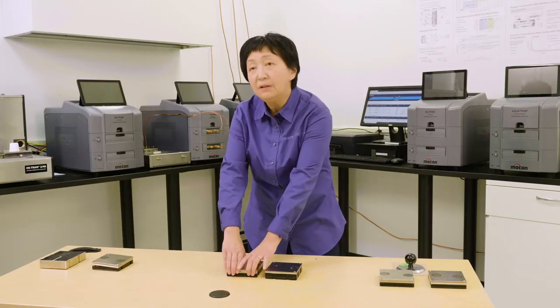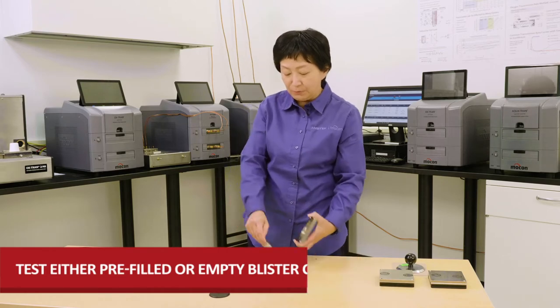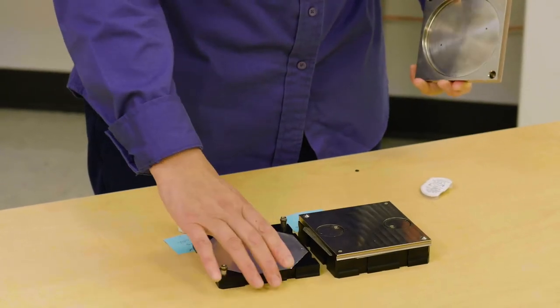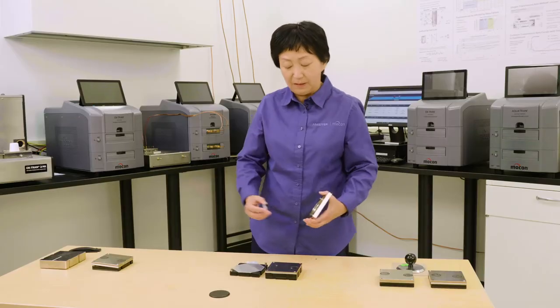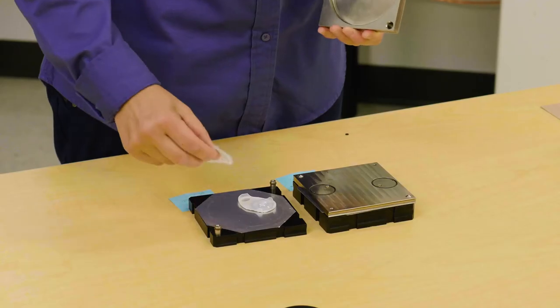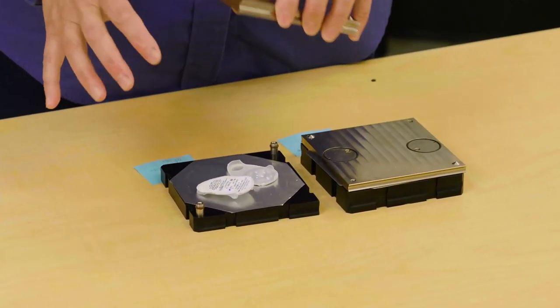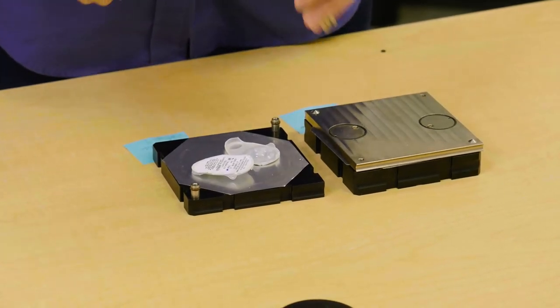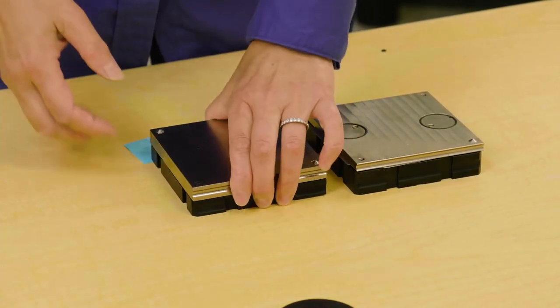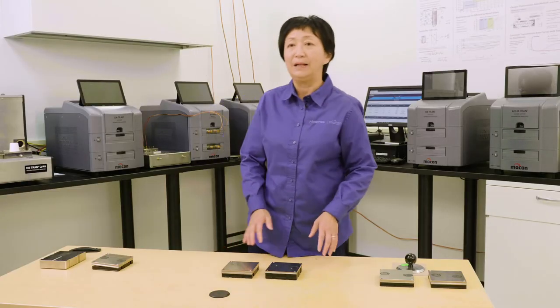Another way is for a pre-filled complete blister. First, we put a foil to block the test gas side and the carrier gas side. You can put one, two, or multiple blisters depending on their size and test them together. Sometimes you need to put multiple together to boost the sensitivity. This way you can test the whole blister like a film test, but for this special application.